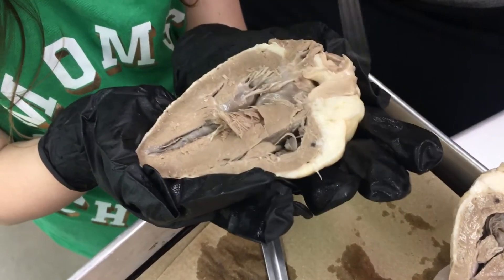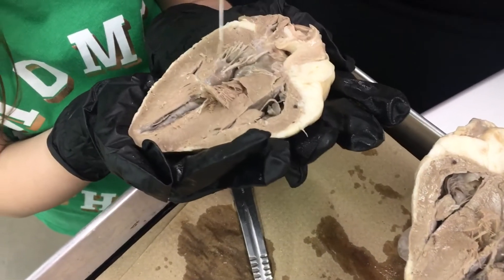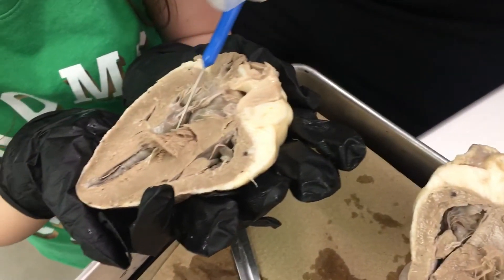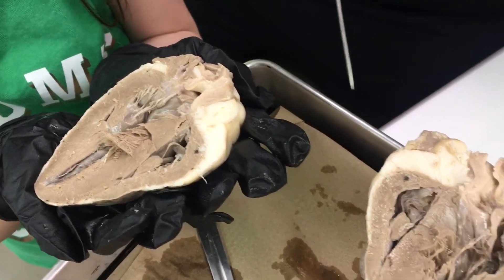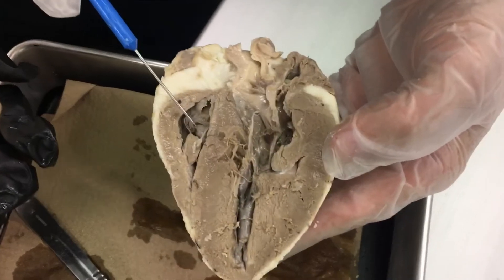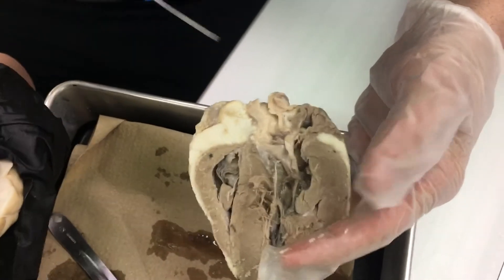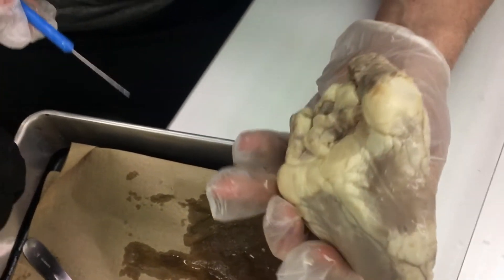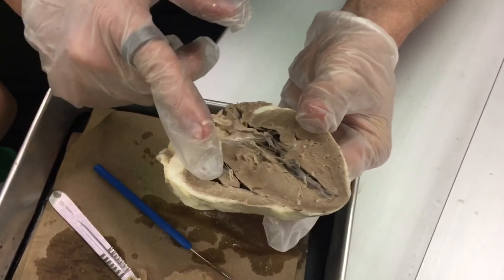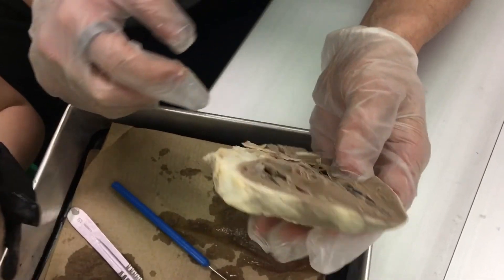You can see that the left ventricle muscle is so much thicker than the right. This is the right ventricle over here. The right ventricle pumps to the pulmonary trunk going to the lungs; the left ventricle pumps through the aorta to the rest of the body. These are the chambers of the left and right ventricle, and the atria are way up here. The great vessels come off the top — this would be the aorta here and the pulmonary trunk comes at this angle through here.